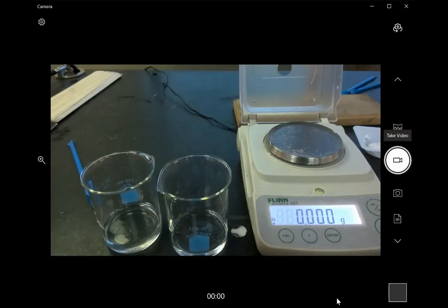Hi, okay, we're going to do our chalk lab where we're going to make chalk from sodium carbonate and calcium chloride. So the first step is to measure out the right amounts of each of those substances.